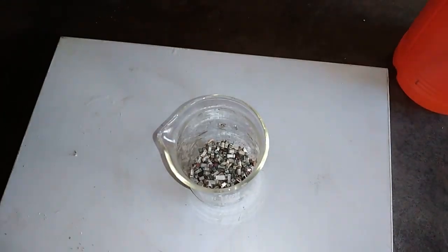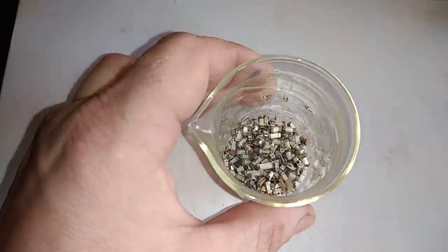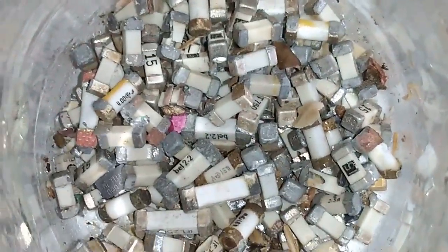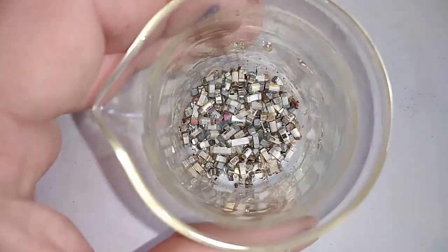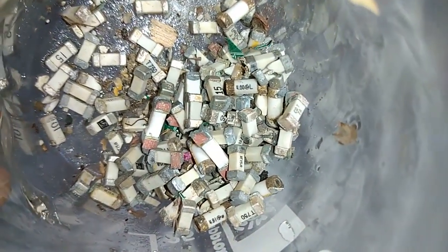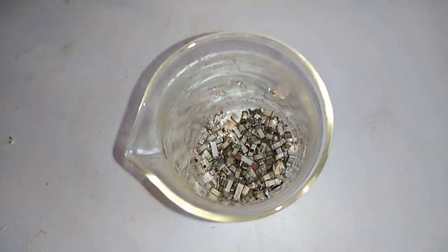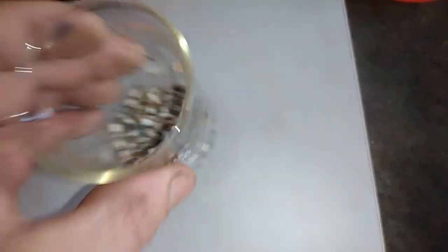What's up guys, friend Usher here, welcome to a new video. Today I have some items which I already have in some of my old videos but in a different shape. This is a white glass ceramic fuse. I already did some videos where I process these little guys, but they were all gold plated. This time, in this little beaker, I have exactly 20 grams of the silver ones. I just want to see what amount of silver we can get from them — probably not too big, maybe just a fraction of a gram, but it will be a fun experiment.